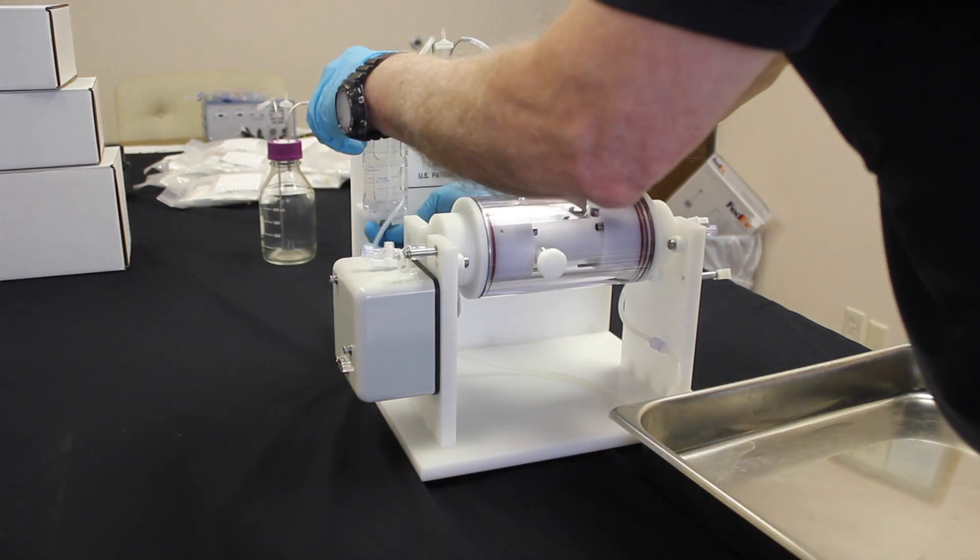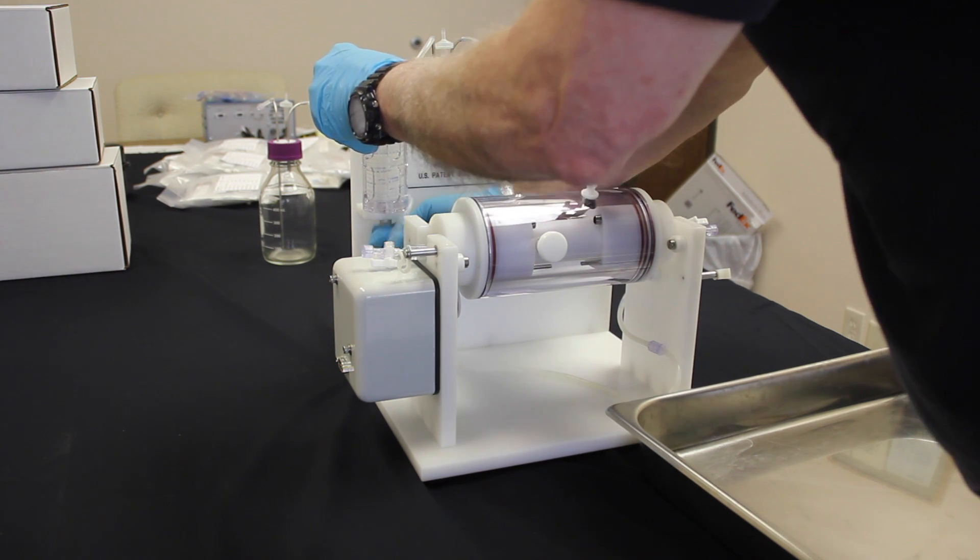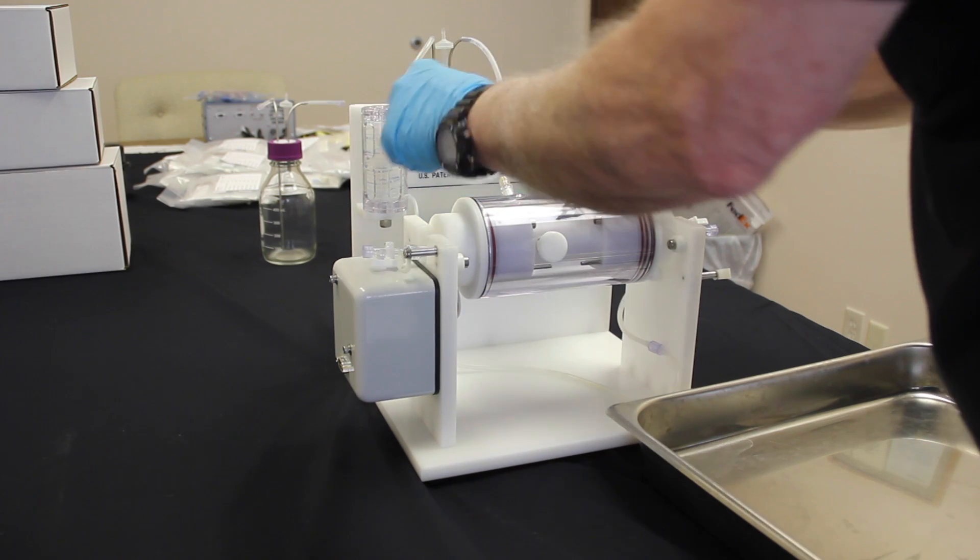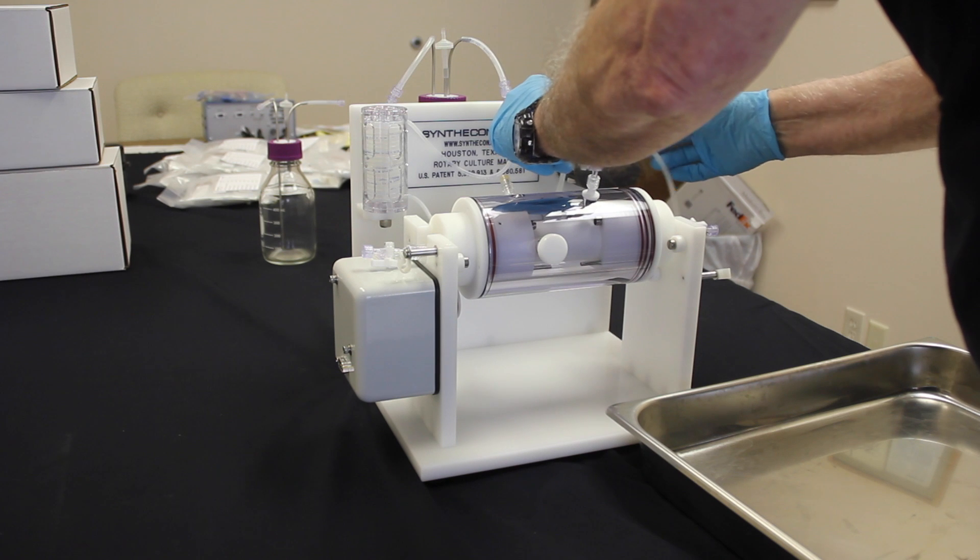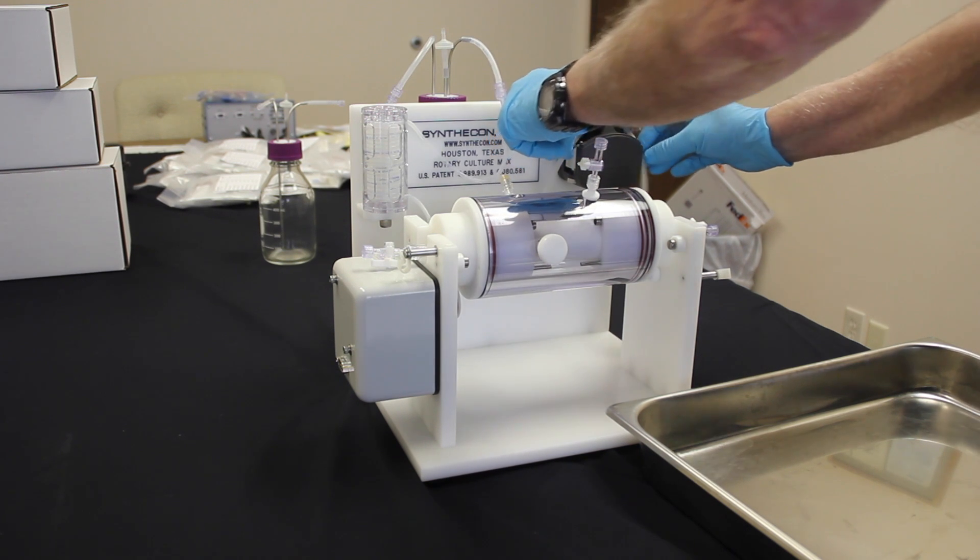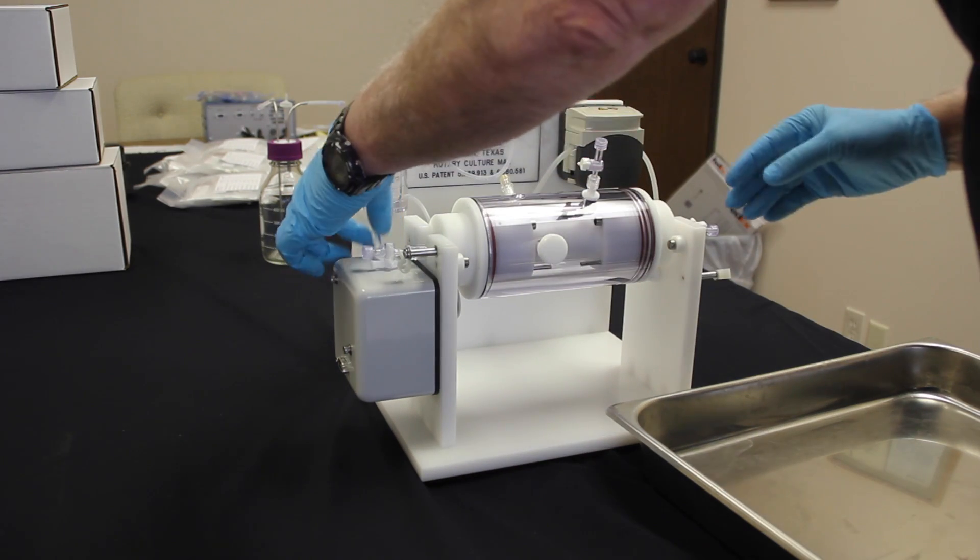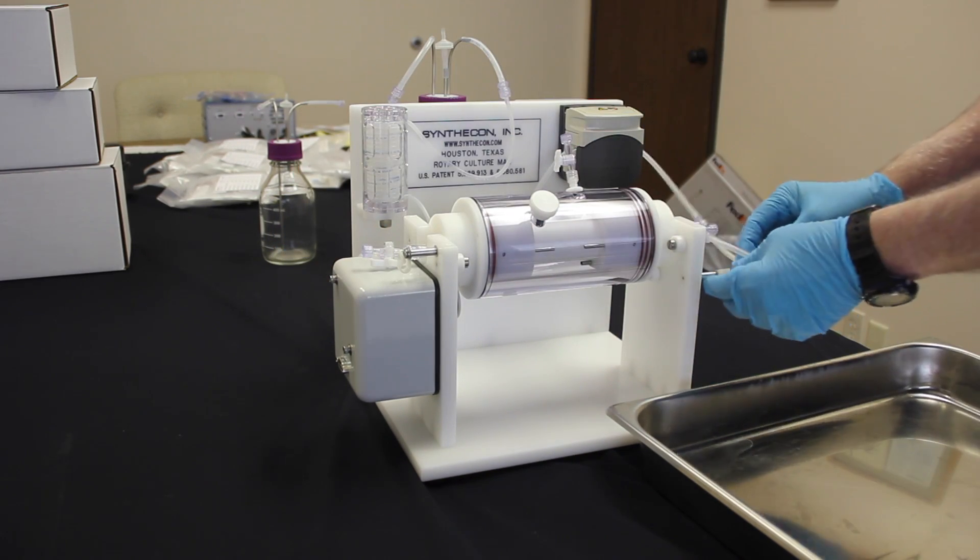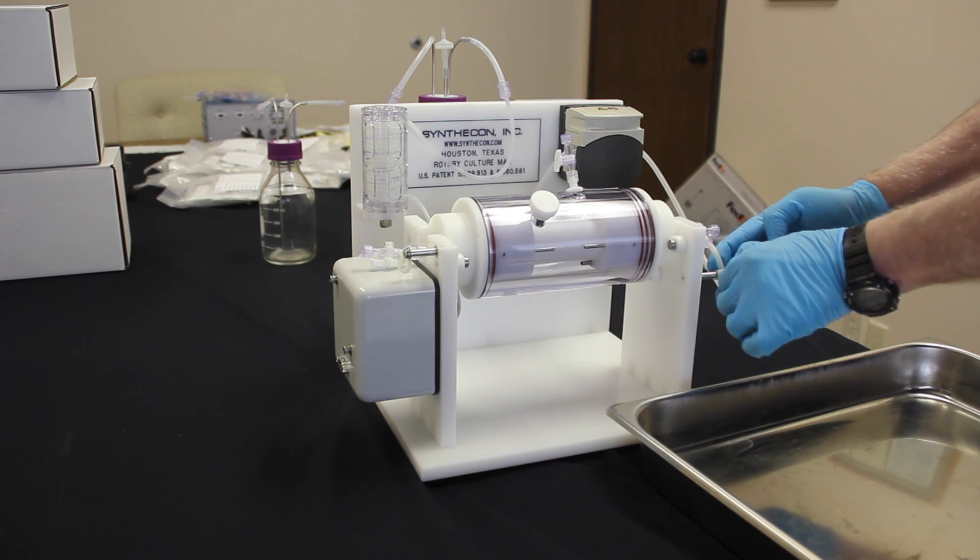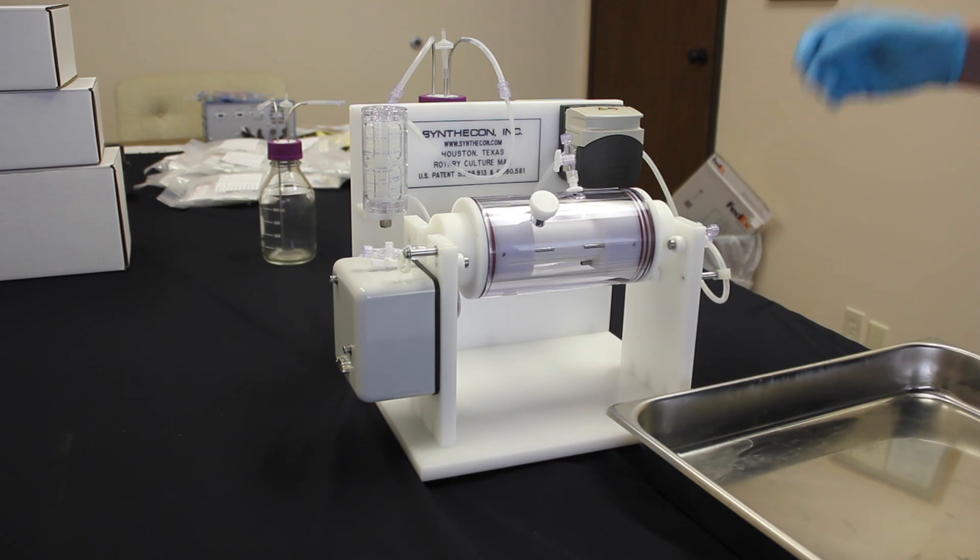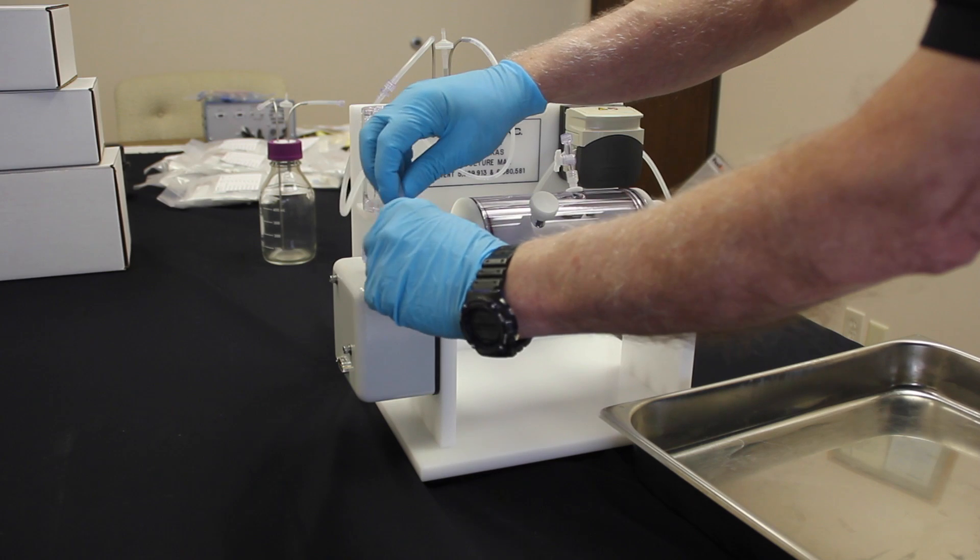What's that called? The oxygenator. Okay. Oxygenator is being placed with a small screw. Then, you feed the tubing through the peristaltic pump and press down to secure it. Next, you feed portions of the tubing that attach to the inflow, as well as the outflow.